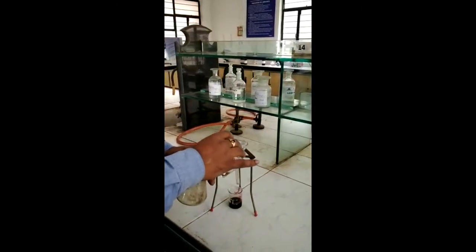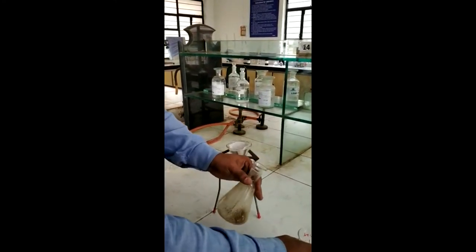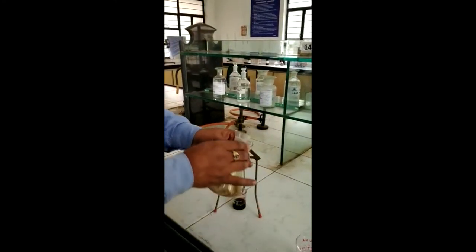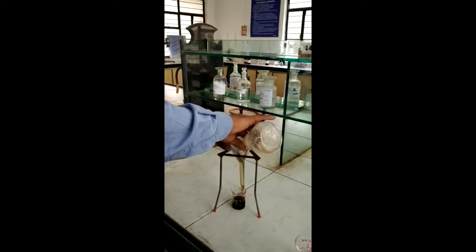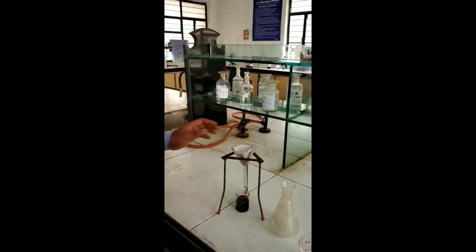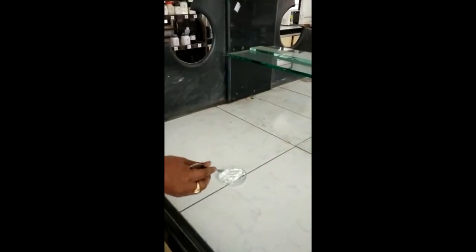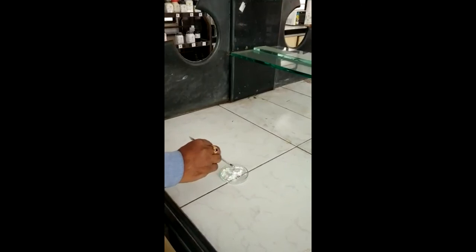Wash it with water. Rinse the product with distilled water. After filtration we will get the precipitate of phenyl benzoate.